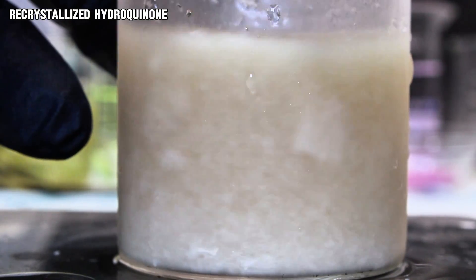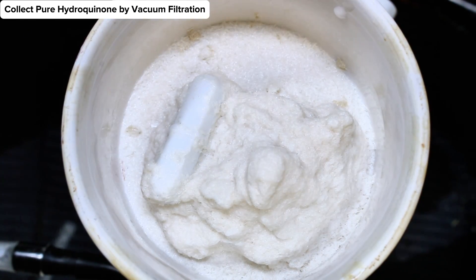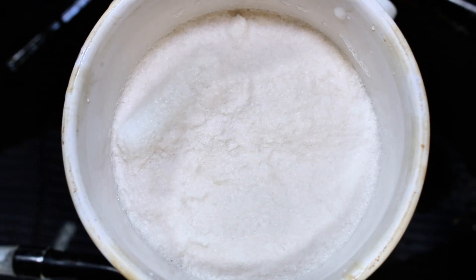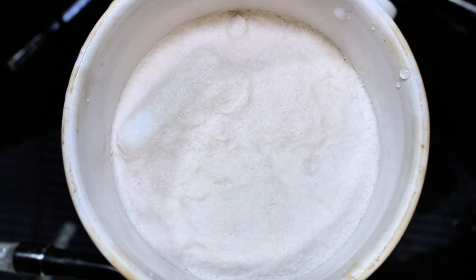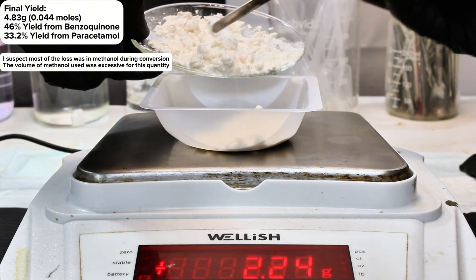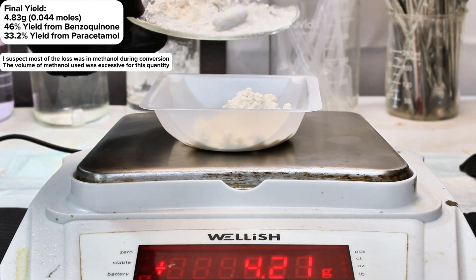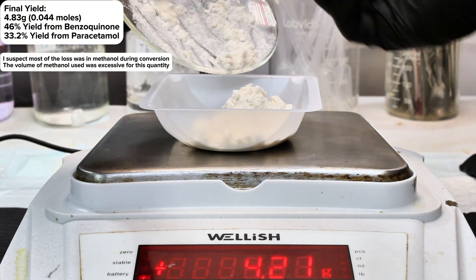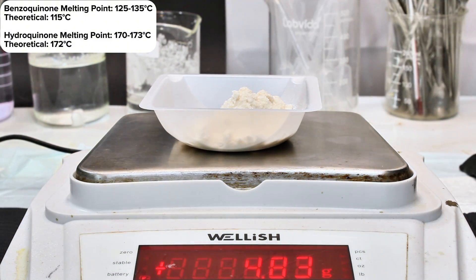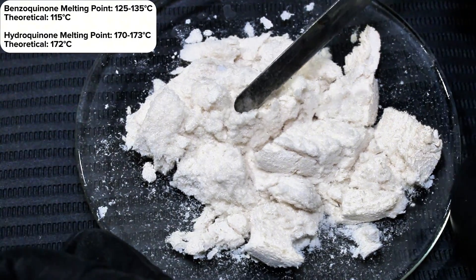This isn't great considering the reduction should have been a straightforward process, and I mostly blame my own sloppiness throughout the entire project. Because I was making every aspect of this up as I went without drawing upon any literature or even outlining a procedure for myself beforehand, I decided after recrystallizing my benzoquinone that my primary concern was to successfully make the target chemical rather than to maximize yield. The result is that I lost a lot of product in excessively thorough rinsings, excessive recrystallizations, and sometimes sloppy transfer of product between beakers. Despite all of this, I do consider this project a complete success. My benzoquinone product was reasonably pure with a melting point between 125 and 135 degrees Celsius, and my hydroquinone was exceptionally pure with a melting point between 170 and 173 degrees Celsius.